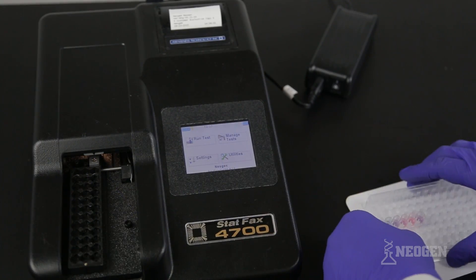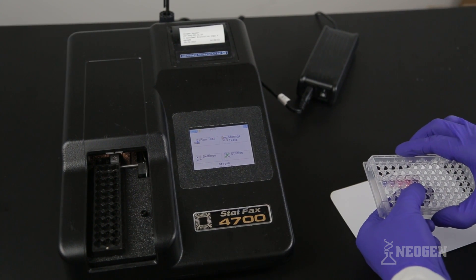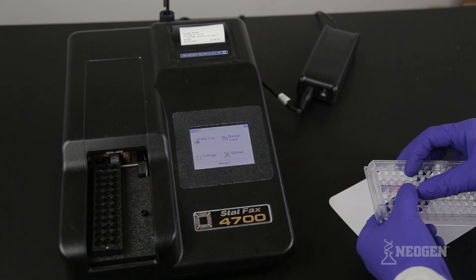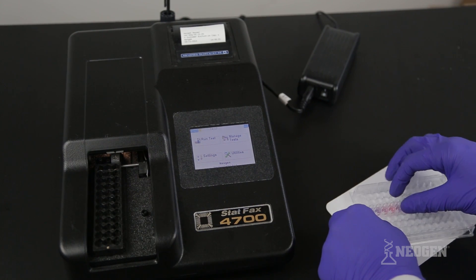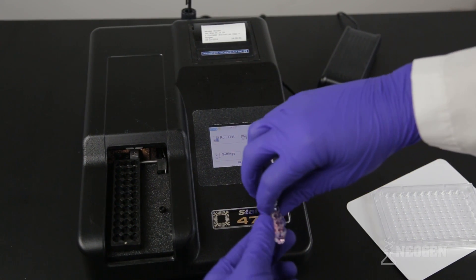You have up to 20 minutes to read the wells using the STATFAX 4700 microwell reader, or an equivalent microwell reader with a 650 nanometer filter. Wipe the bottom of the microwells and place them into the reader with the zero control entering the reader first.